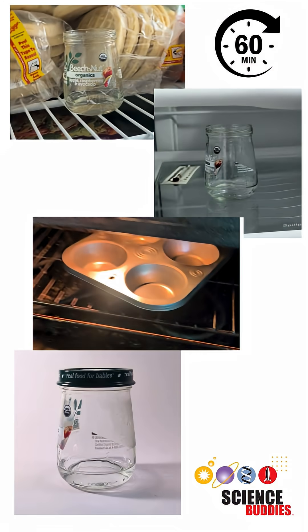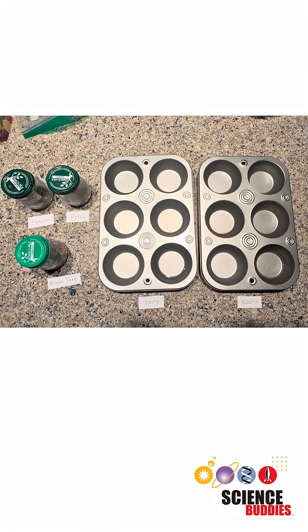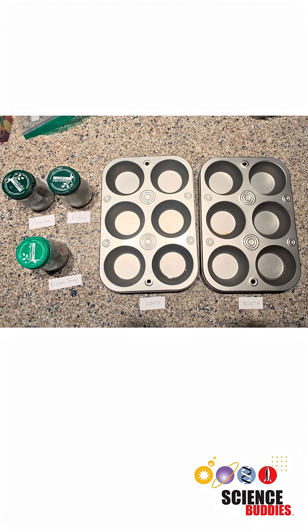Let all of your samples sit at the correct temperature for 60 minutes. Once you are all done temperature treating your different samples you should have five different ones that look like this.